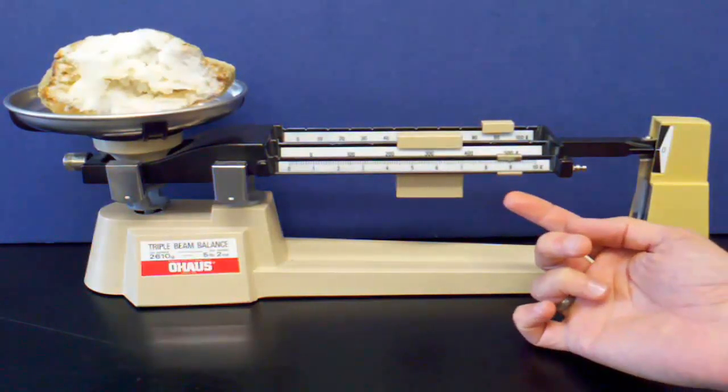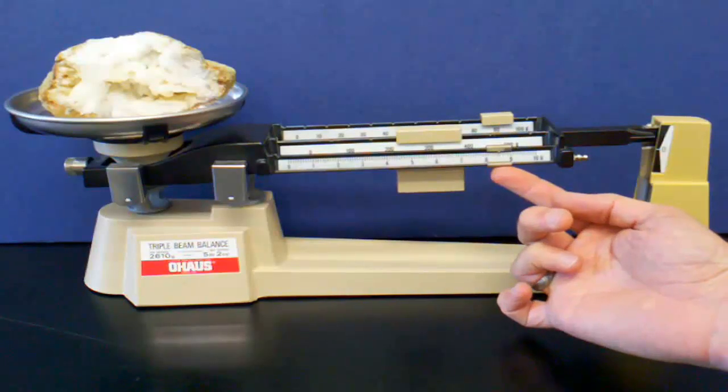This indicates that there is equal mass on both sides of the pivot point.